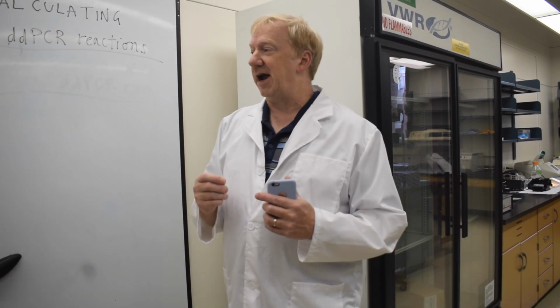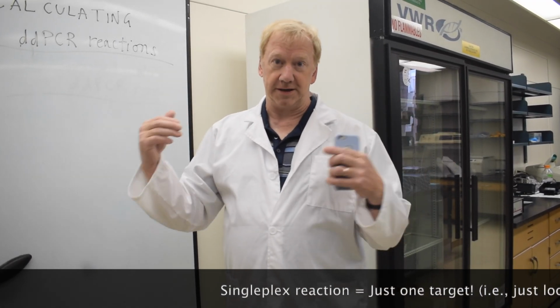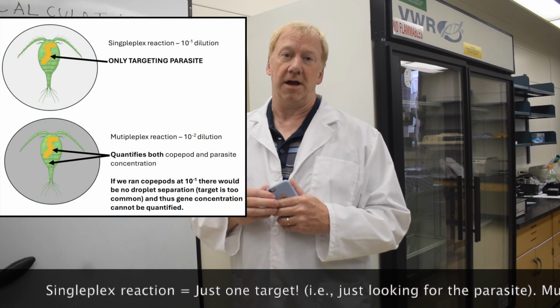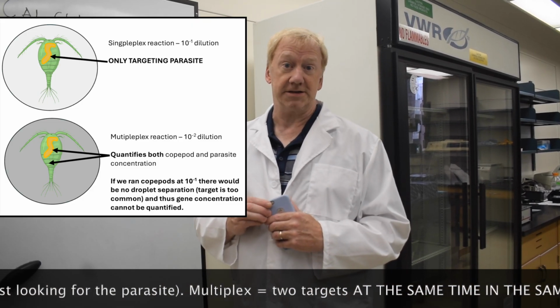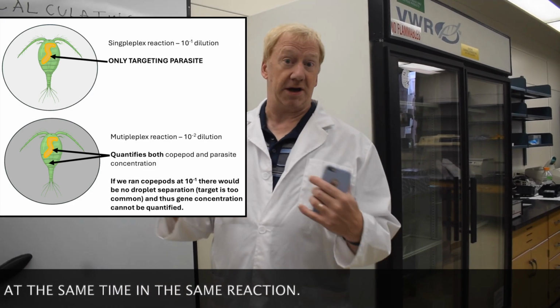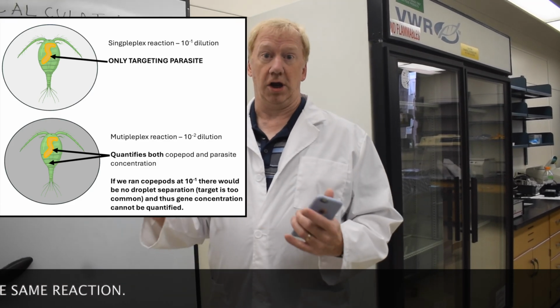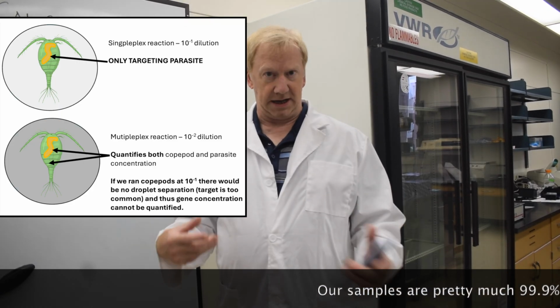The singleplex reaction uses just a single probe. We're making a single amplification product and then looking for a single product with a single probe. In this case, it will be the Schistocephalus solidus, and we're using a higher template concentration for that so that we have a better chance of finding very low amounts of the template DNA in our sample.